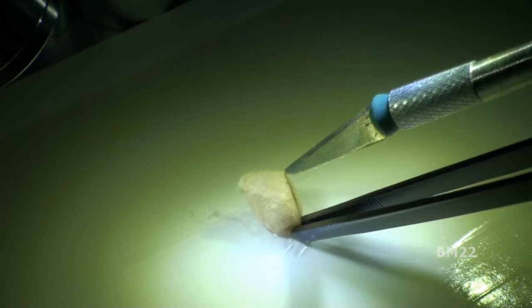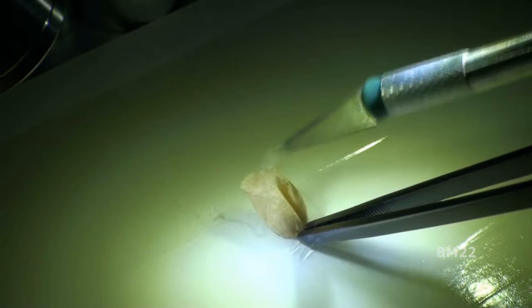Remember we did the devil's salt shaker when we had those egg sacks in the salt shakers until they hatched? Yeah, that was creepy. And something else we have not done in a long time is we have not used our KK Moon video microscope, so we're gonna fire up the old microscope and we will open this egg sack.